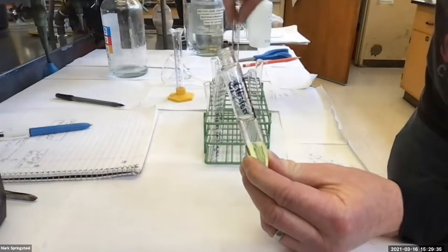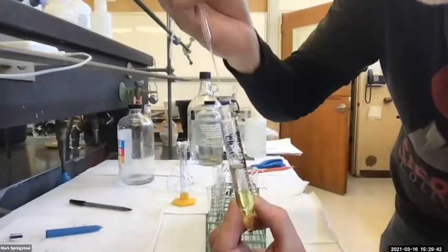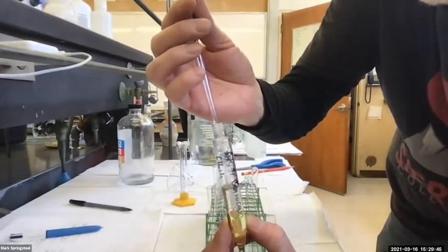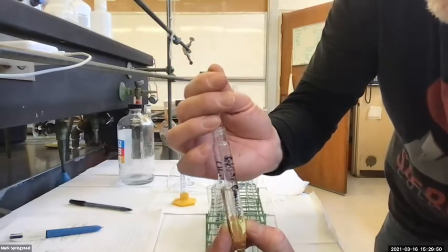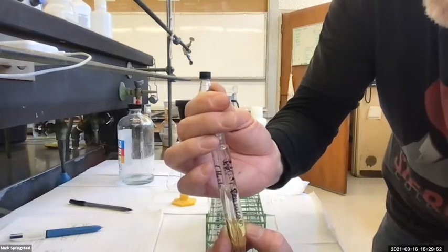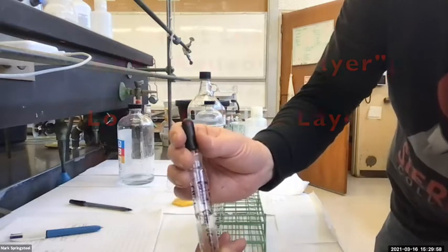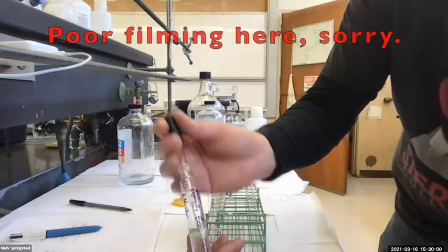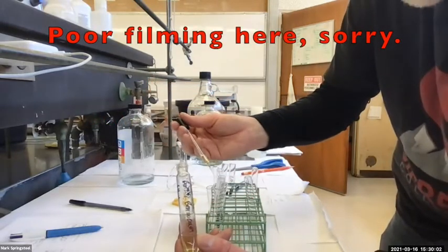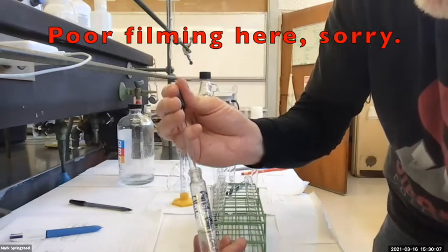Okay, here we go. I'm going to stick my pipette through the aqueous layer. And what I like to do is push the bulb and give it a little pressure so it won't grab any of the aqueous layer. And then I go down to the bottom, and that's a nice draw of some of the lower organic layer. When I'm coming out of the aqueous layer, I go quickly so I do not pick up any. When I'm coming out of the organic layer, I go quickly to try not to get into the aqueous. So let me try to do that again.